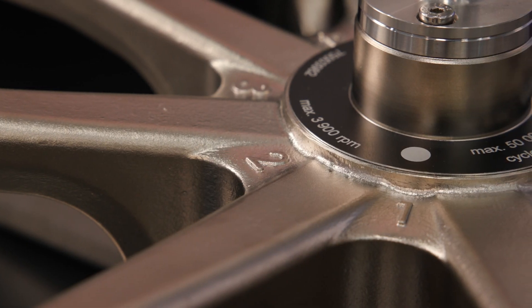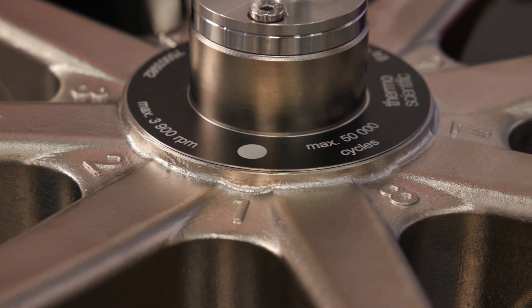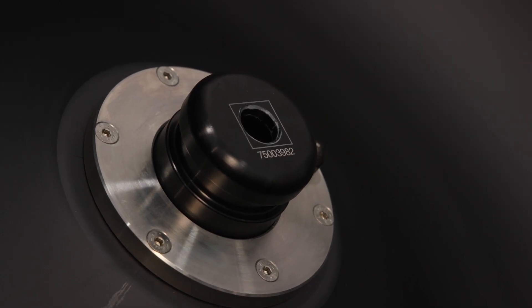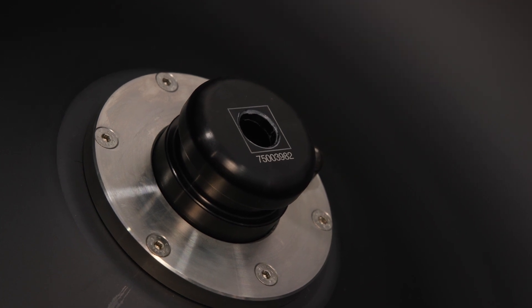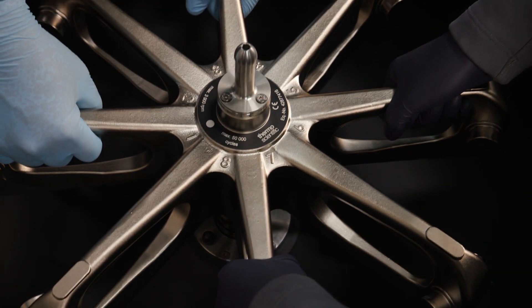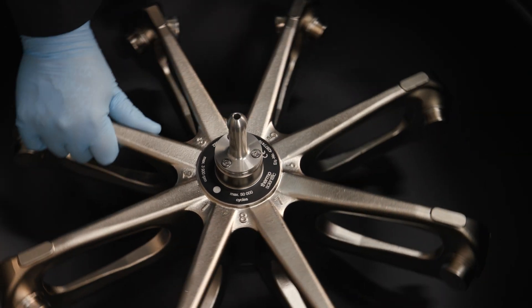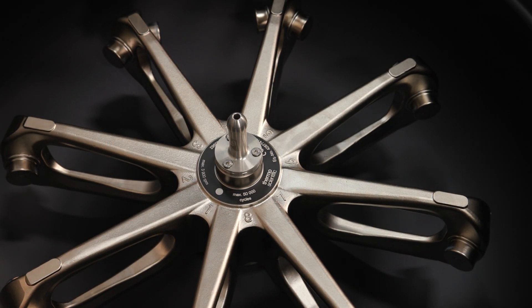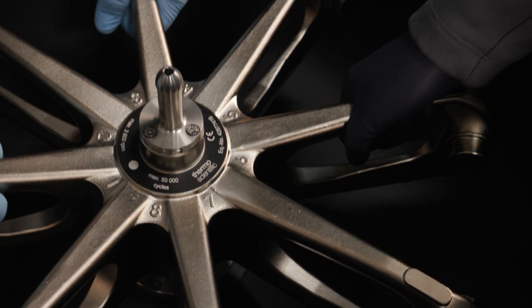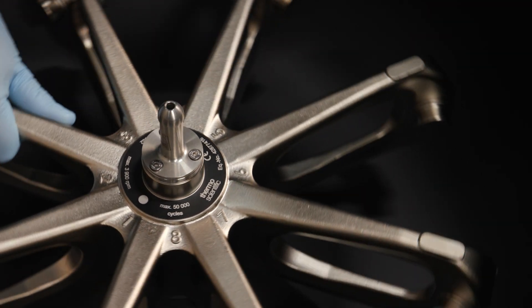Next, identify the circular marking on the rotor body. The hole for the locating pin of the windshield bowl is on the bottom side of the rotor body, below the circular marking. Hold the rotor body over the drive shaft and align the circular marking with the locating pin on the windshield bowl. Put the rotor body carefully onto the drive shaft. Turn the rotor body against the windshield bowl until the locating pin engages into the rotor body. If the rotor body is not engaged correctly, you will not be able to turn the rotor locking screw into the drive shaft. Repeat these steps until the rotor body is in position.